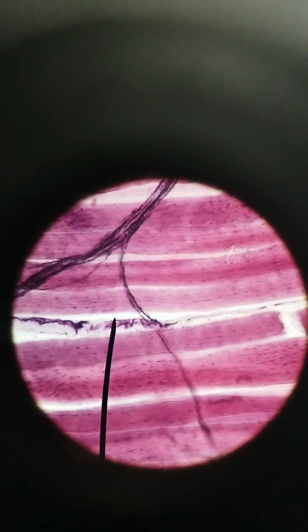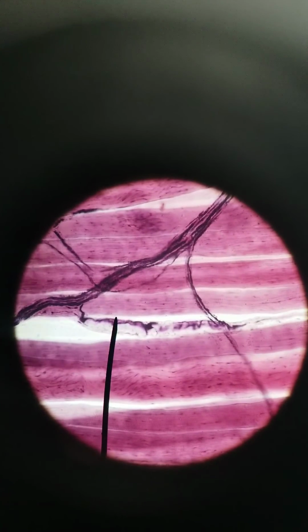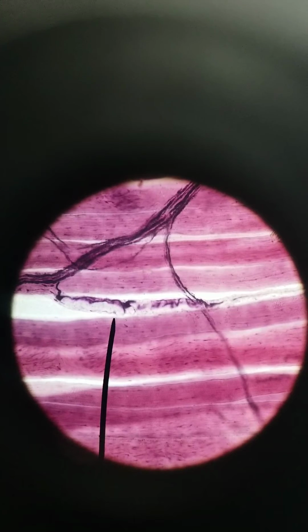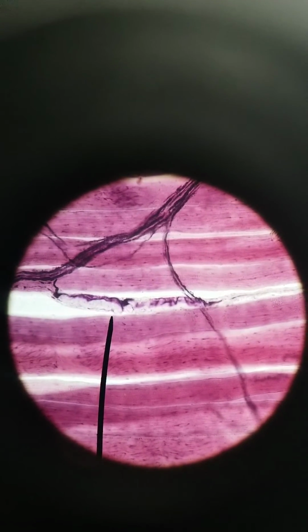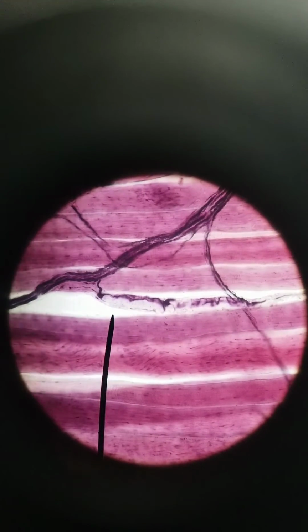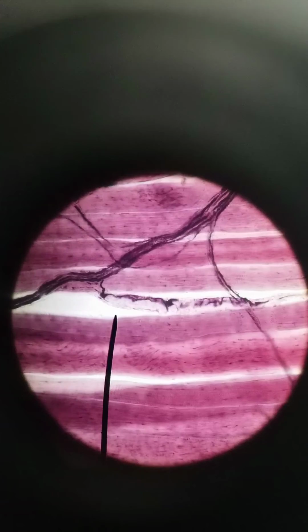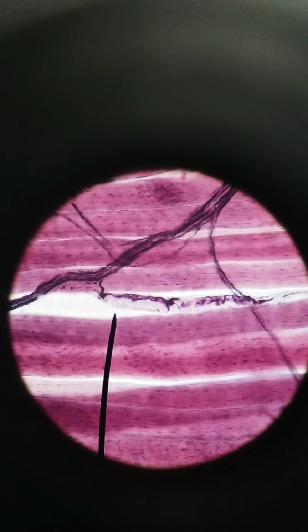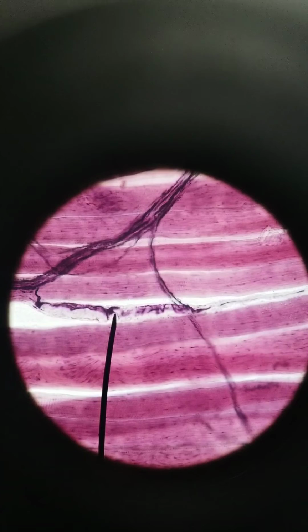Muscle spindles detect stretch, the state of how stretched out the skeletal muscle is. That allows us to maintain muscle tone. That helps us with reflexes like the stretch reflex where you catch something. That's mediated by this muscle spindle. It allows you to maintain muscle tone in different situations.